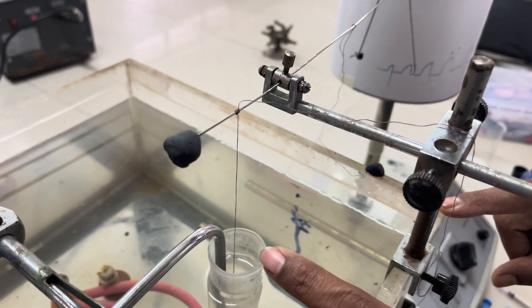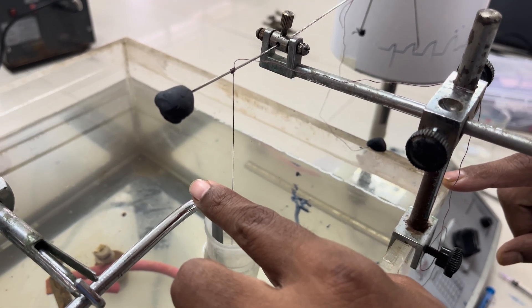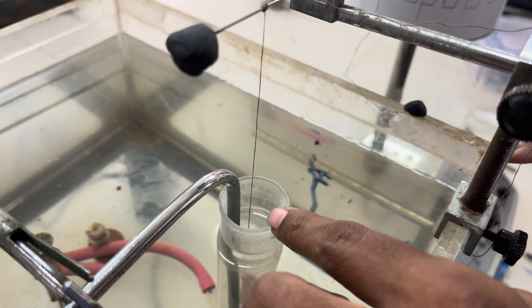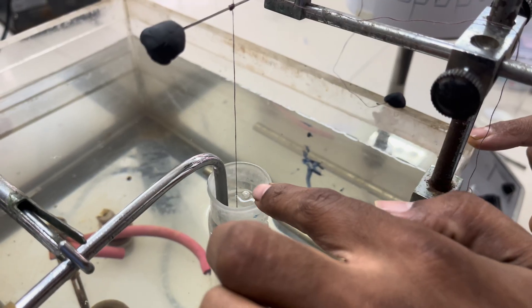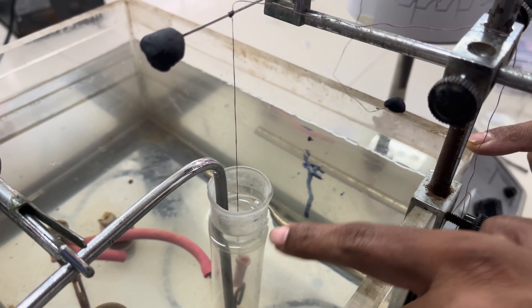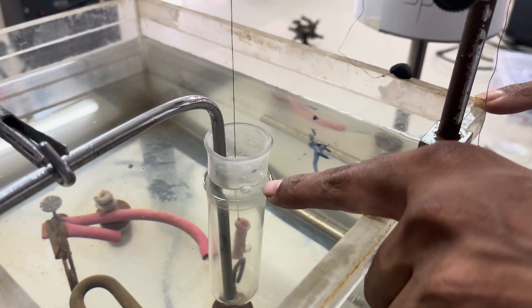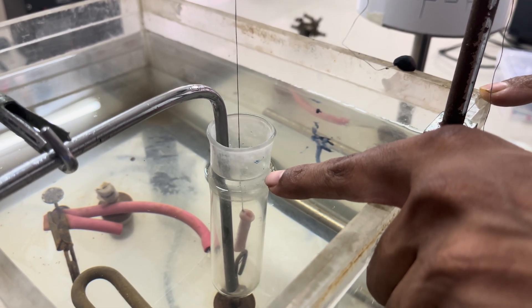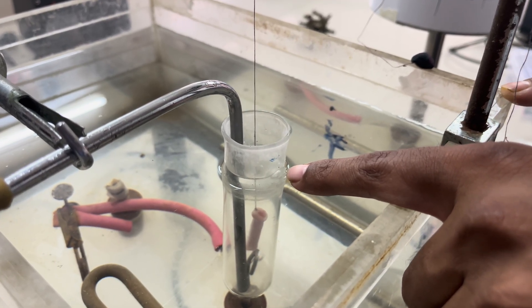The thread is attached to the lever and should not stick to the connector or the organ tube. A very important point: when you fill the PSS into the organ tube, you must mark the level and always fill the PSS up to that mark. Otherwise, there will be a change in dilution and you will not get a proper response.